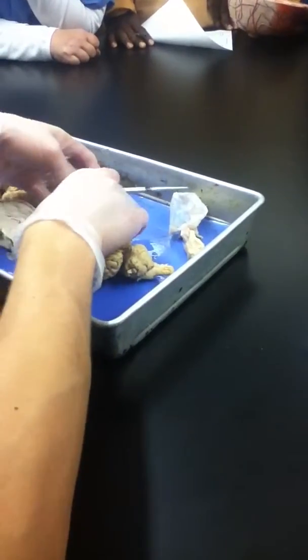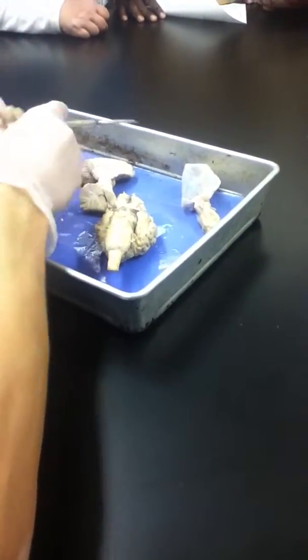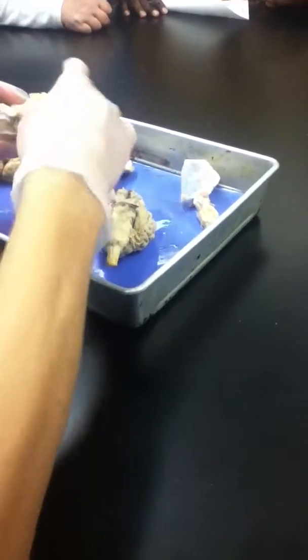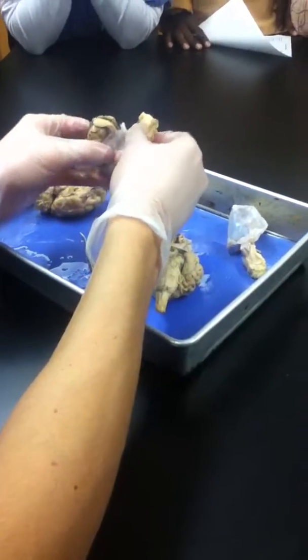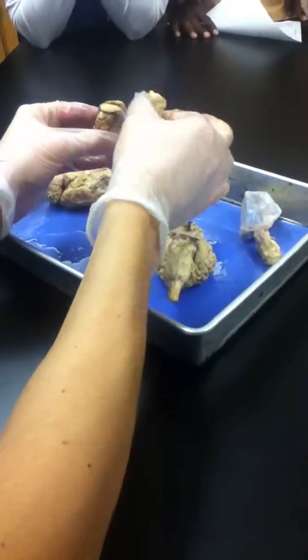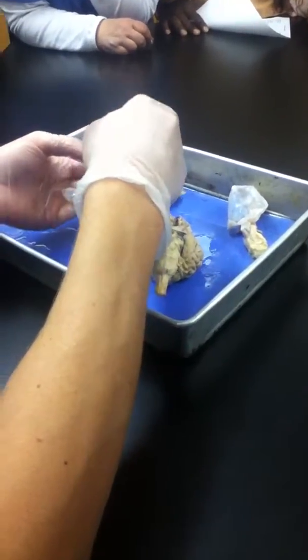What about the pituitary gland? Isn't that hanging right there at the bottom? By your thumb? What, here? No, up. Here? Yeah. That's the optic chiasma, just seen from a different angle. Okay. What do you think this is? Fat. It is fat, but what do you think it would connect to? The muscle, the... Temporal. This is the fat at the back of the eye. You can see how this is still connected to a piece of optic nerve right there.